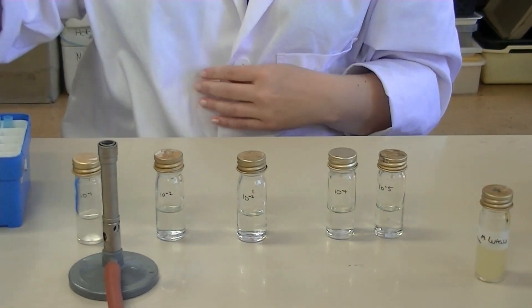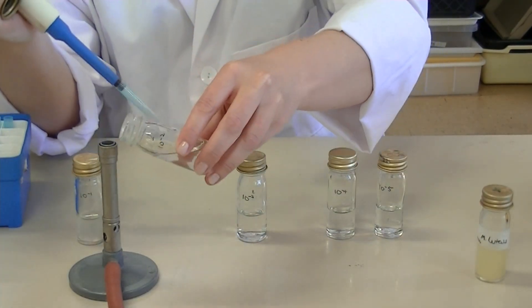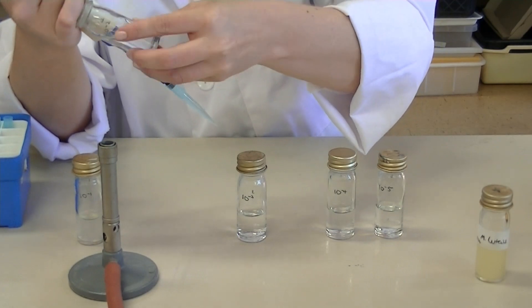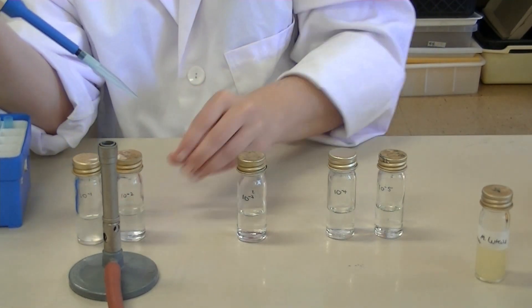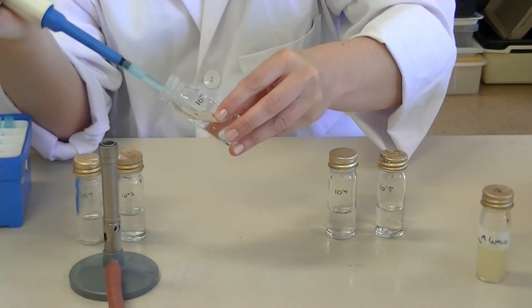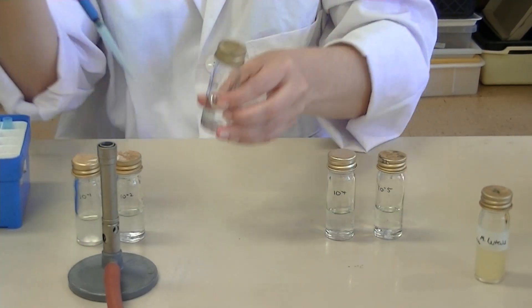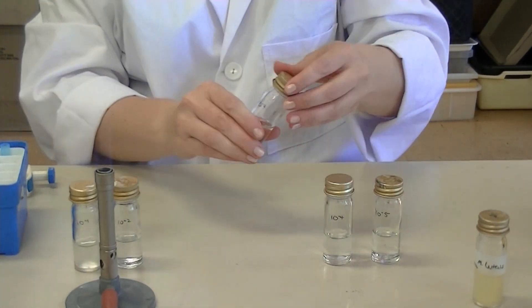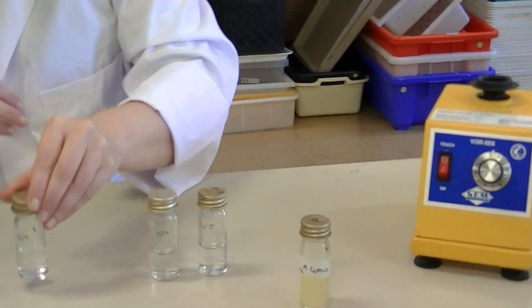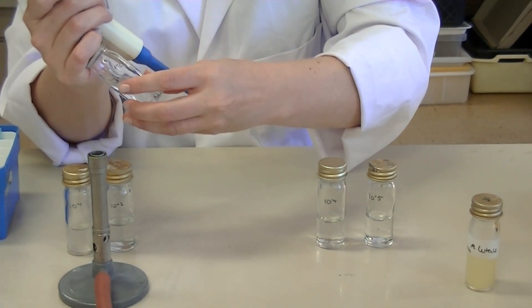For the 10⁻³ dilution, collect a fresh tip, use the crook of your finger to remove the lid, flame the neck of the bottle, collect 1 mil, and transfer it to the 10⁻³ bottle — flaming the neck, transferring 1 mil, flaming again, and replacing the lid. Eject your pipette tip, give it a mix on the vortex, and then keep performing the dilutions right up to 10⁻⁵.